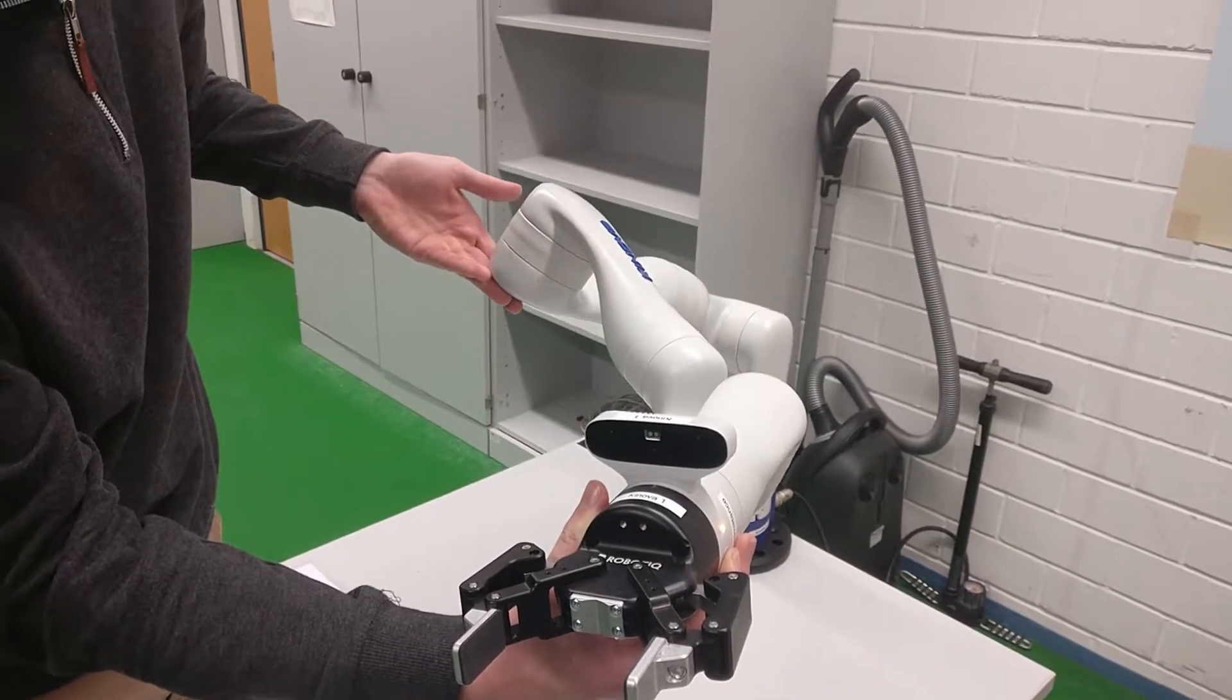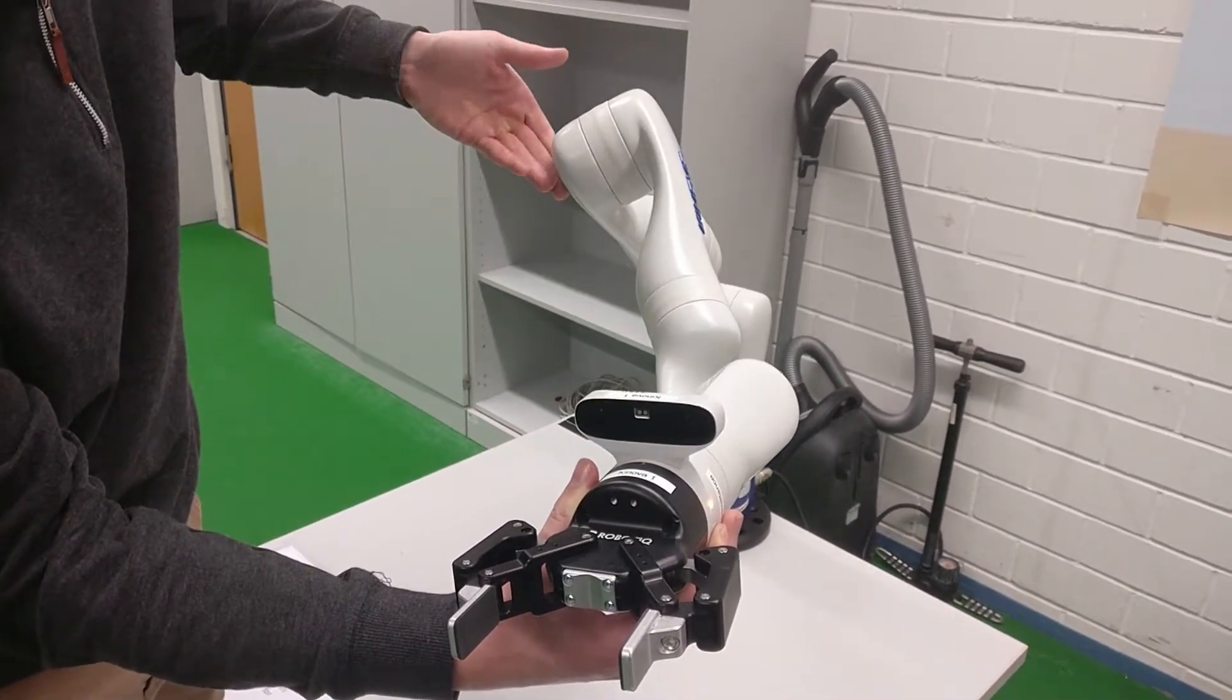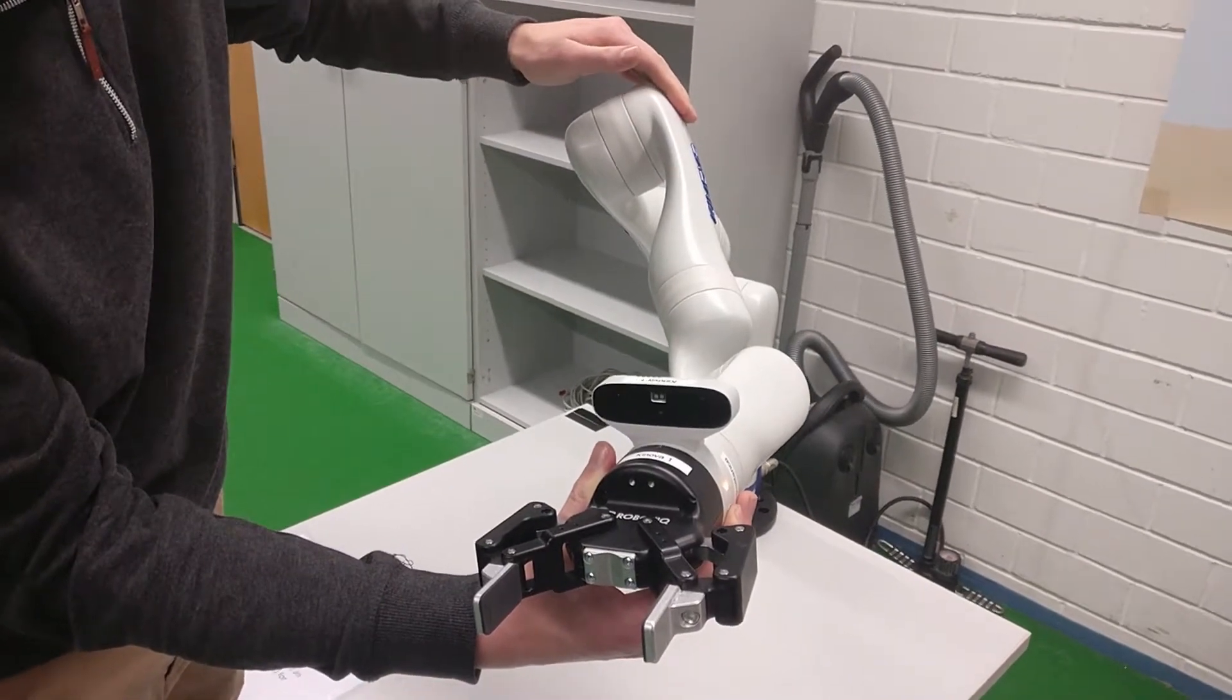And during this mode, it will also detect singularities and joint lock, making sure no damage or irregular behaviour happens.